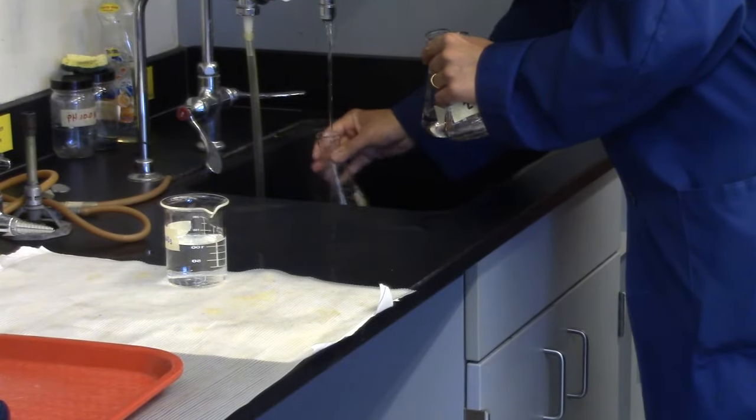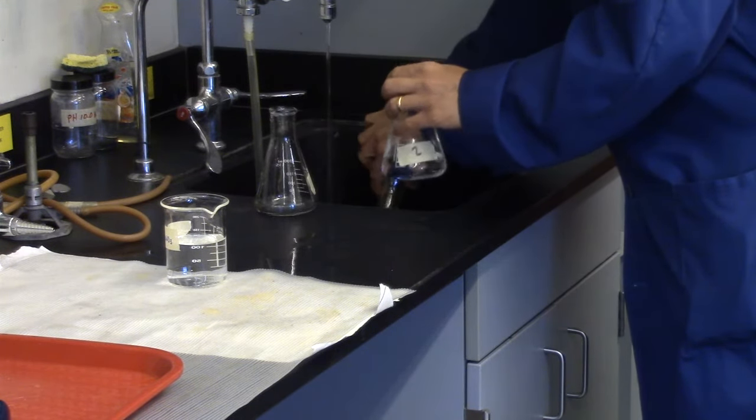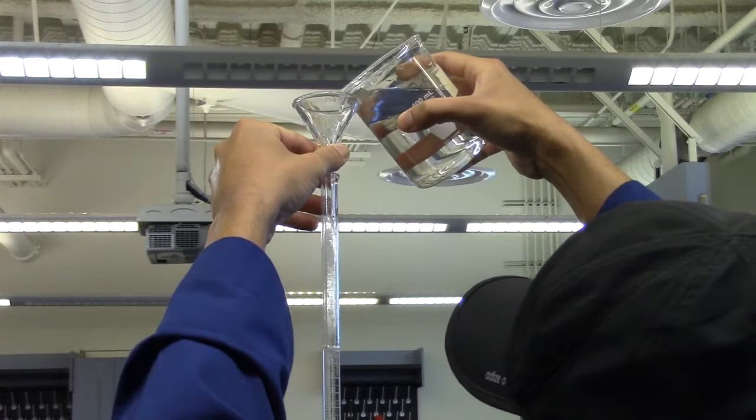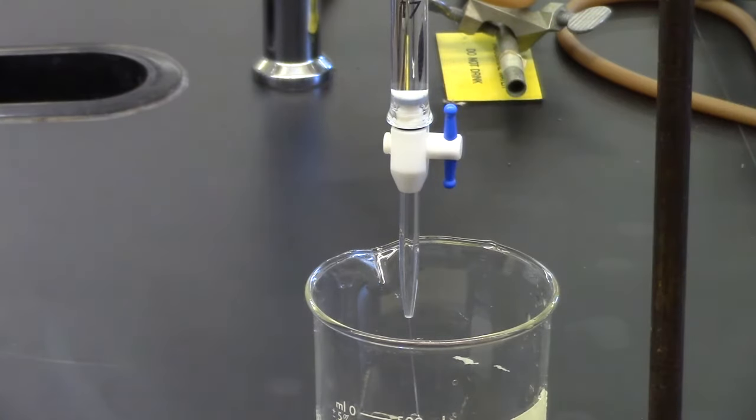These samples may be disposed down the sink along with any remaining sodium hydroxide solution. Remember to rinse burette thoroughly with distilled water. Filling it three times with distilled water and letting it drain should be sufficient.